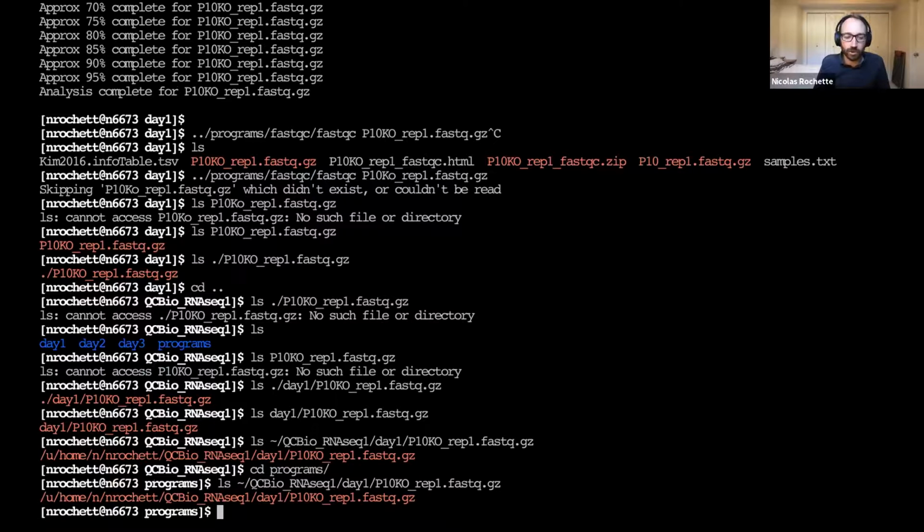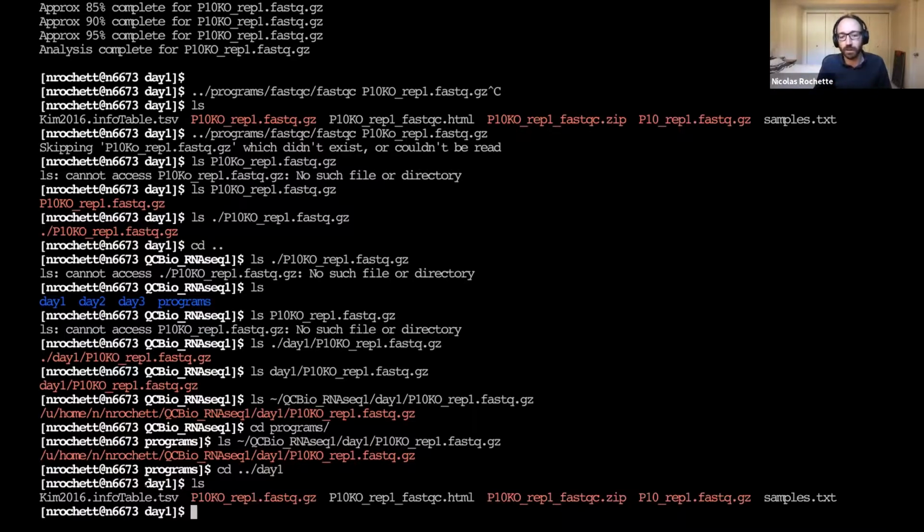And so that was the issue with why you had to specify the path. Regardless of what you're doing, you're specifying a path because you're giving the file name, and the file name is a path. But the first time it didn't work out because you were not in the day one directory. And so for paths, you always have 2 options: changing your current directory or giving full paths. And the thing is, by giving full paths just for the input file, you fix the path for the input file, but then the output file was in the current directory. So by fixing the problem with a full path for the input file, you can introduce the problem that the output file was not in the right directory.